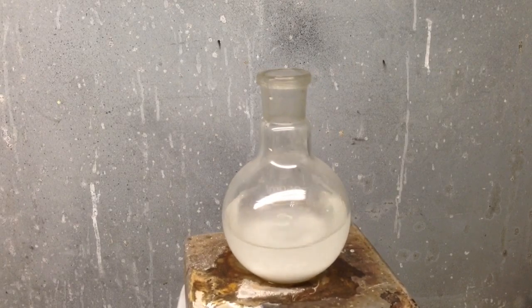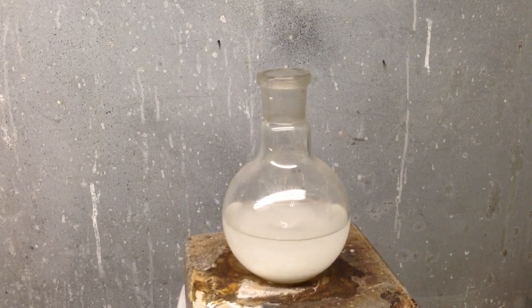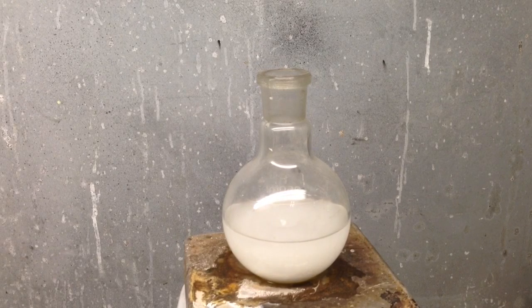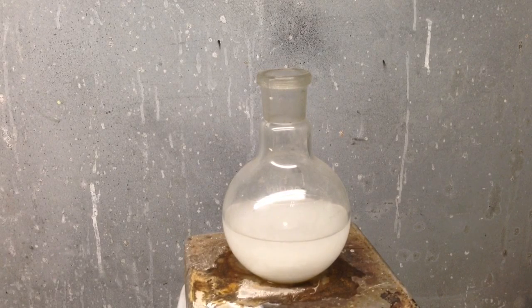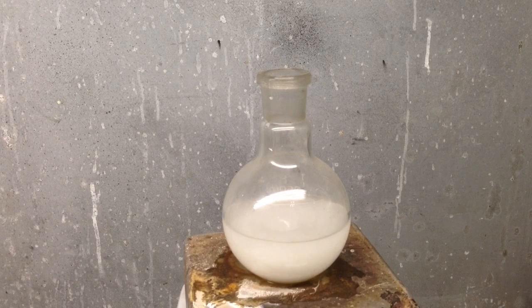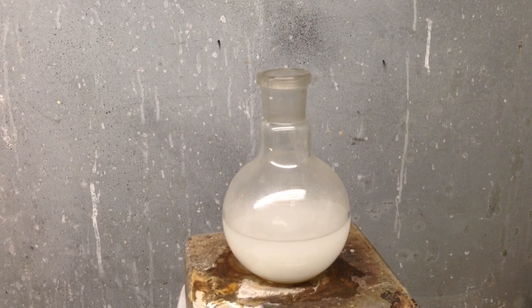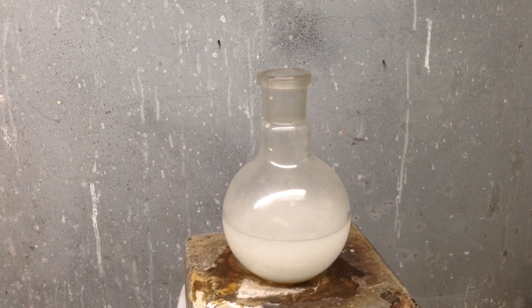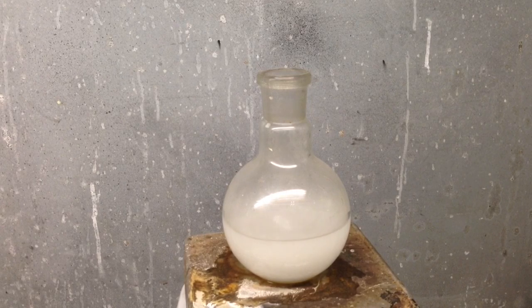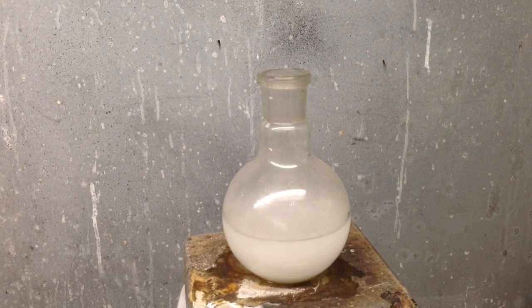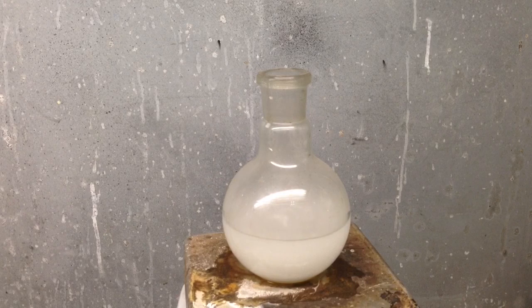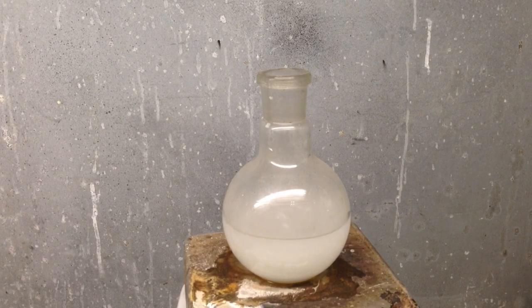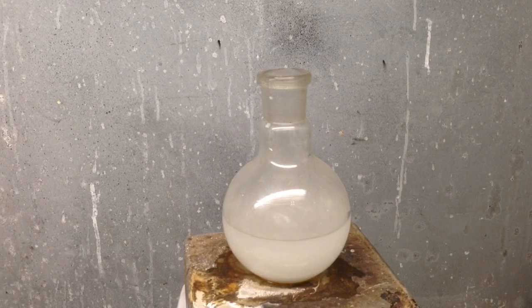You're going to want to let that stir. I'm going to go ahead and turn on the fume hood at this point. This reaction can give off some pretty nasty fumes. So this should be done in a fume hood or outside, at least in a well-ventilated area.